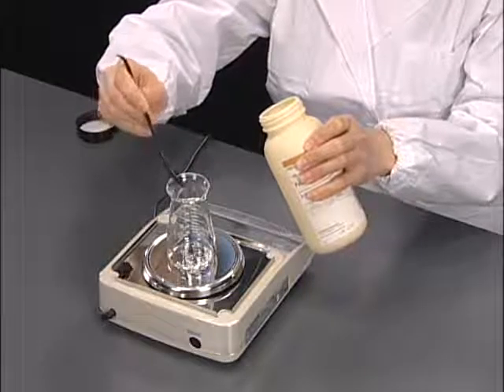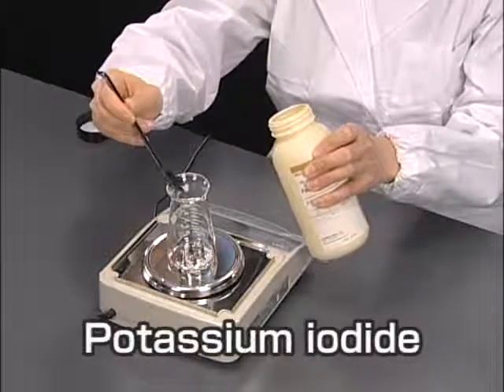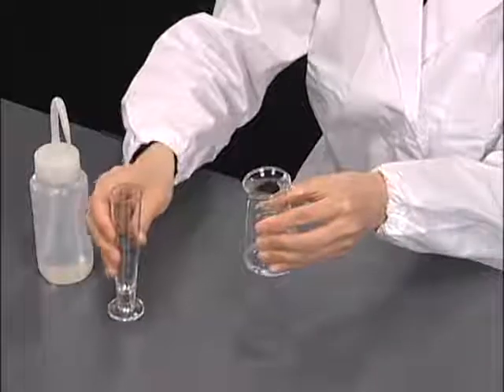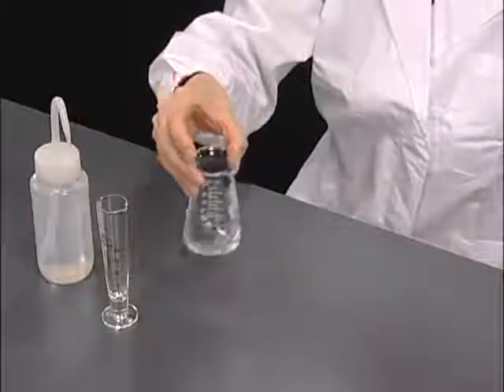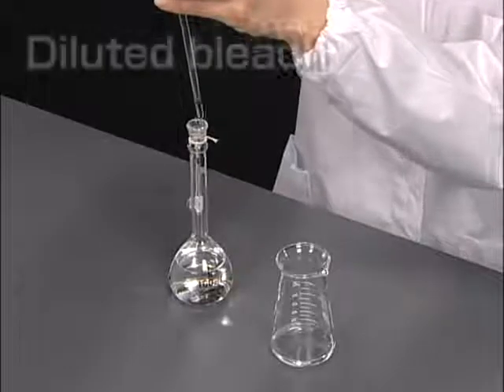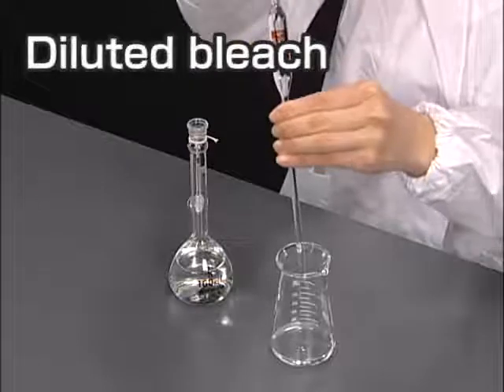Take the prescribed amount of the reducing agent, potassium iodide, in a beaker. Dissolve this completely in distilled water. Add the diluted bleach to this solution using a volumetric pipette.